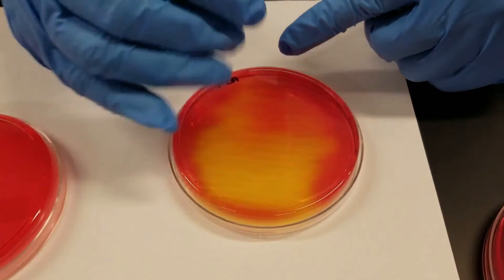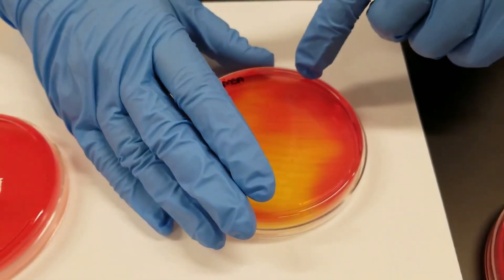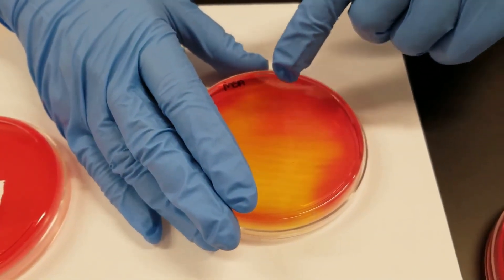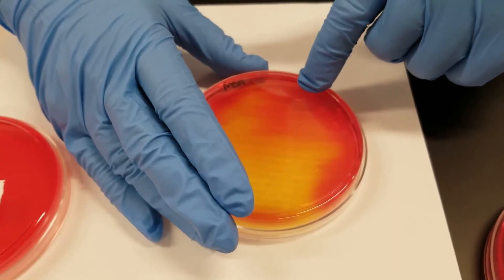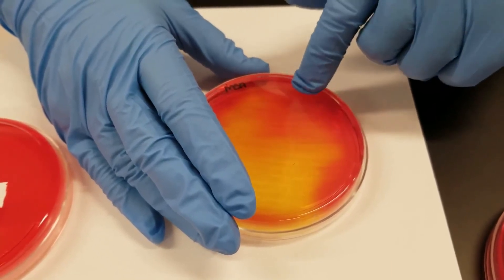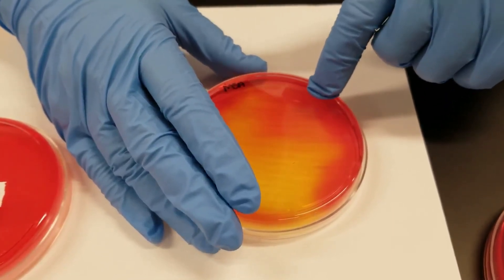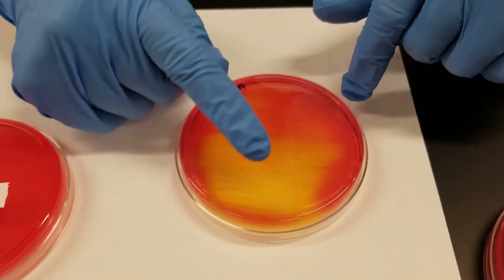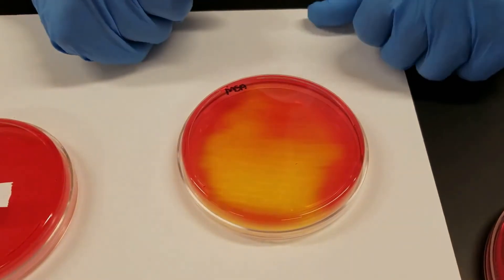However, in the upper portion of the plate over here where we inoculated it with staphylococcus epidermidis, it will grow because it can tolerate the salts, but it will not turn it yellow. So this is the differential portion of this plate.